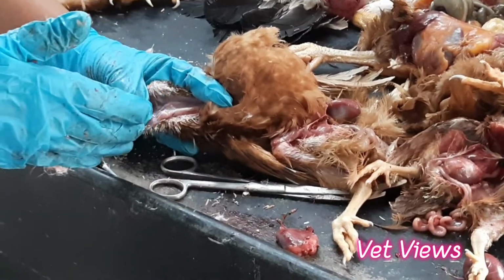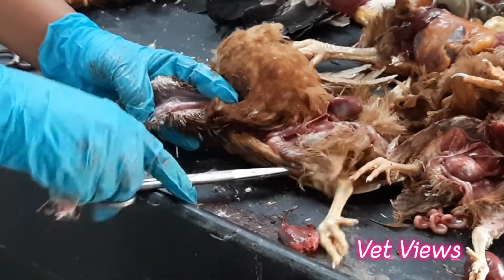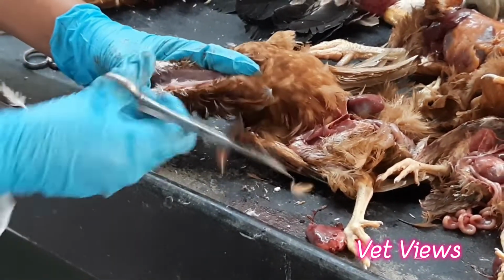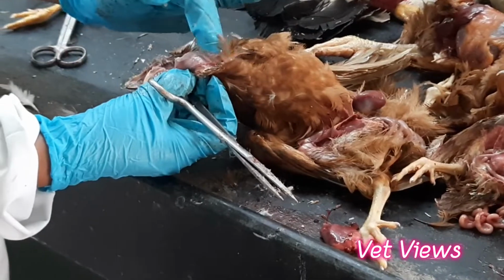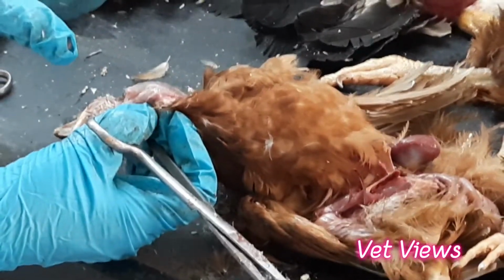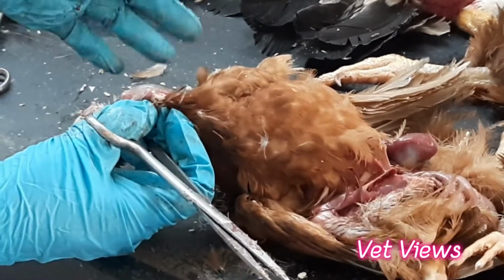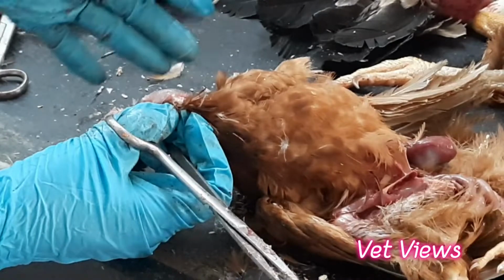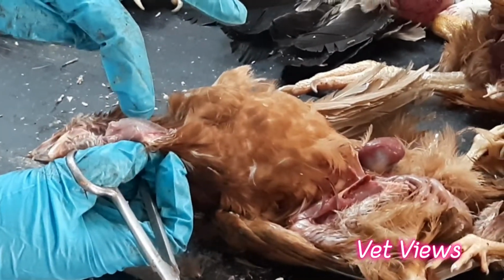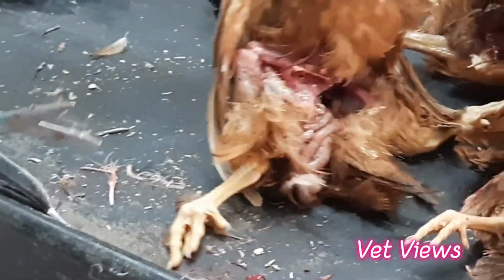And when it comes to the postmortem, you have to cut open the trachea. Here you will see clear blood clots. If you open this, now it is normal. Okay. In ILT, it will be completely filled with blood clot. Because of that suffocation, birds die in ILT. So only the upper respiratory tract will be affected. In other respiratory infections like Newcastle disease and bird flu, you will see slight hemorrhage in the tracheal membrane. Okay. That you have to observe. This is about the trachea and upper respiratory tract.